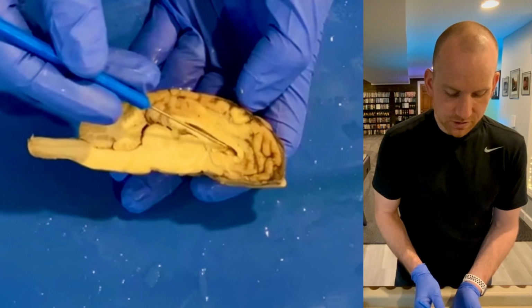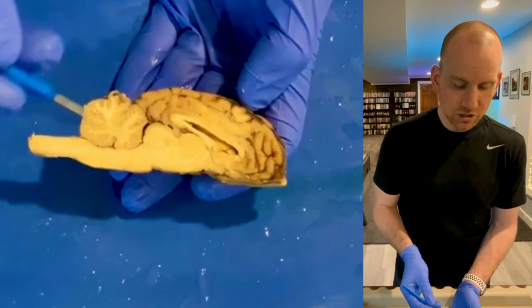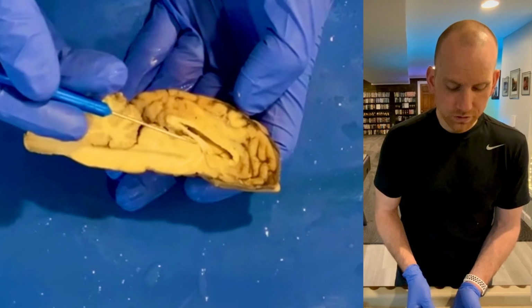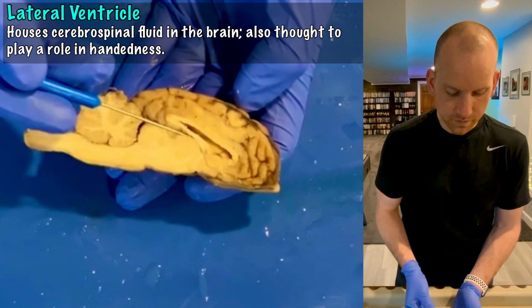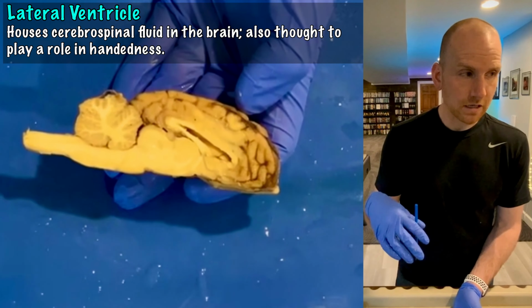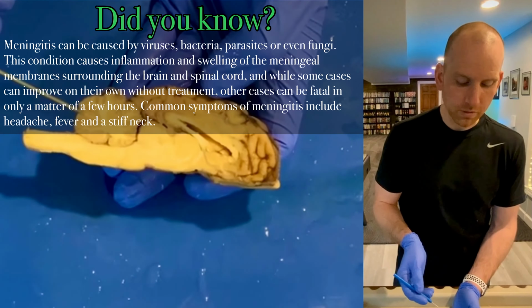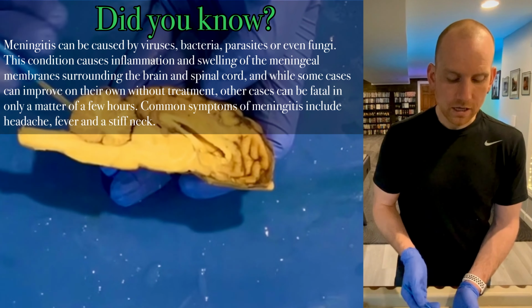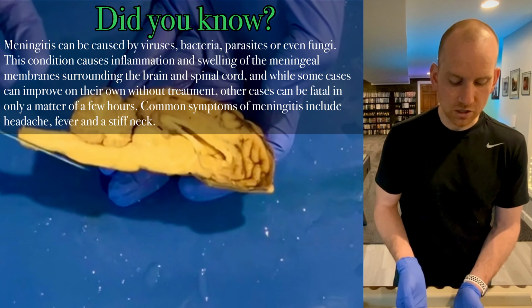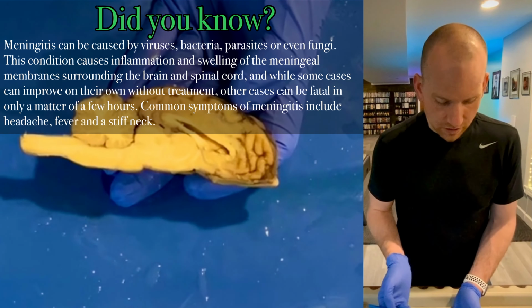I did mention the corpus callosum already, but what you can see inside the corpus callosum, where my fine-tipped probe is currently, is this cavity, right? There's actually a ventricle inside of the brain. And that ventricle is called the lateral ventricle. It is possible, by the way, for that ventricle to become essentially poisoned by bacteria and stuff like that. You've probably heard of bacterial meningitis. So the meninges outside of the brain and the ventricle on the inside would actually become contaminated with a special type of bacteria to give you bacterial meningitis.